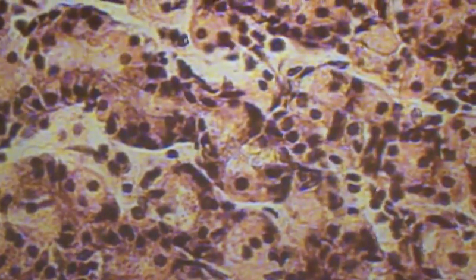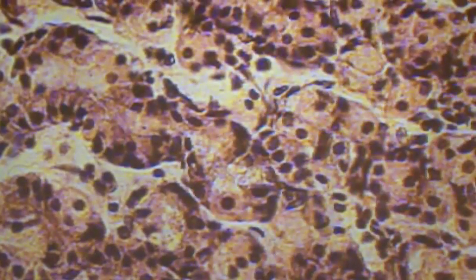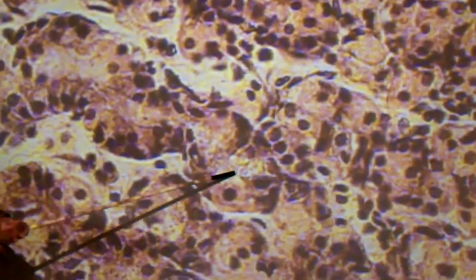There's a mixture of several cell types in this area. We're only going to identify two. What you're going to be looking for are cells that look like fried eggs versus cells that don't. On my slide, this isn't staining very well. But look at this nice round nucleus right here, and look at all the cytoplasm around it. This one right here is what we're looking for — this is a parietal cell.